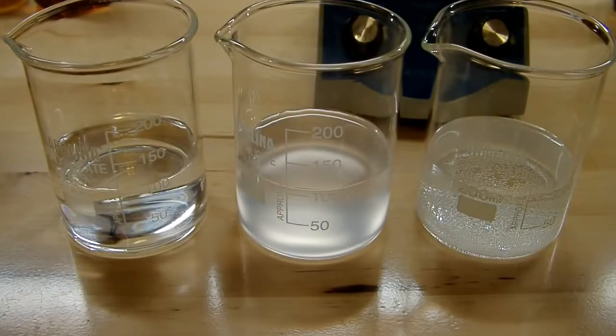Hey YouTube, in this video I'm going to be doing the classic Briggs-Rauscher iodine oscillating reaction. This is actually a highly complex reaction where as many as 30 different things can be happening simultaneously. I have a paper that claims 30 things are possible, but they've narrowed it down to maybe 11 or 12 that are necessary for the reaction to work.